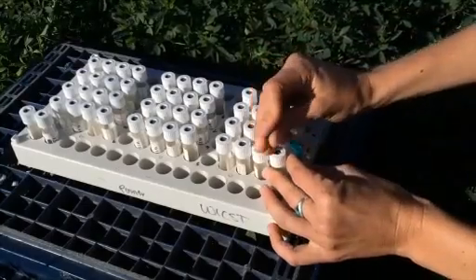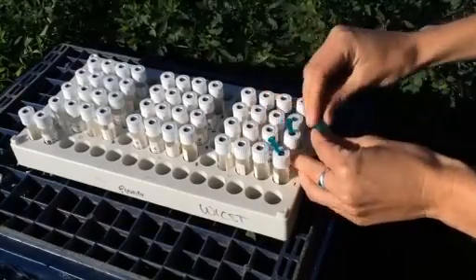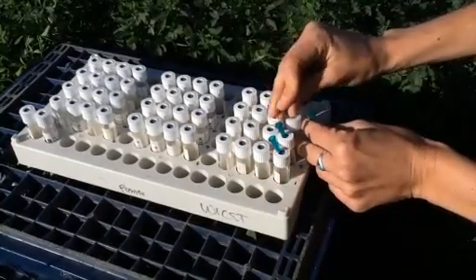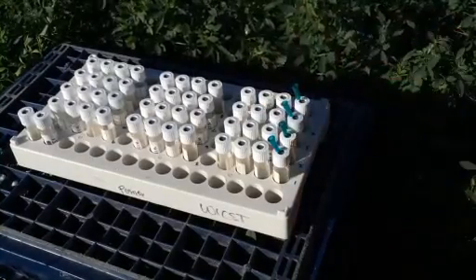Prior to sampling, pre-label and arrange collection vials for maximum efficiency and to reduce the likelihood of confusion during sampling. One vial is required per time point per chamber.